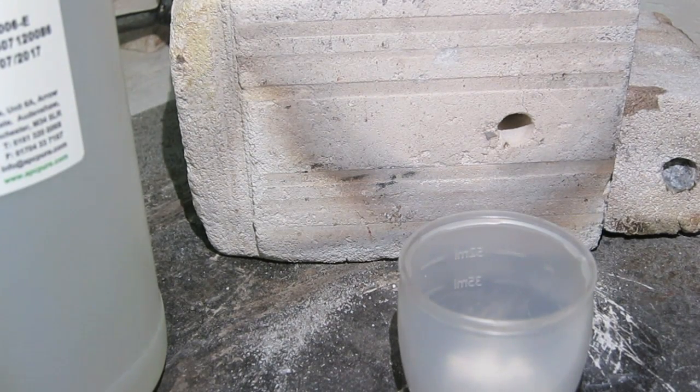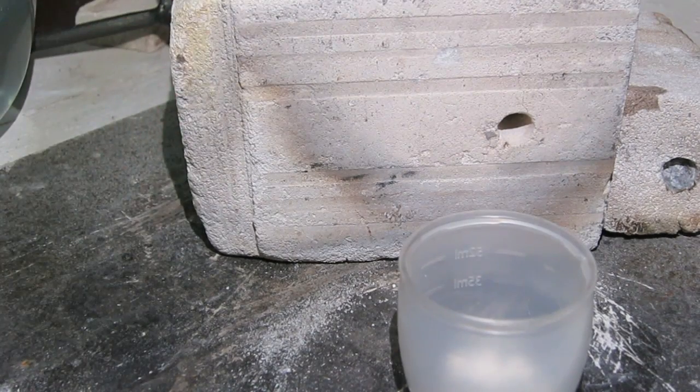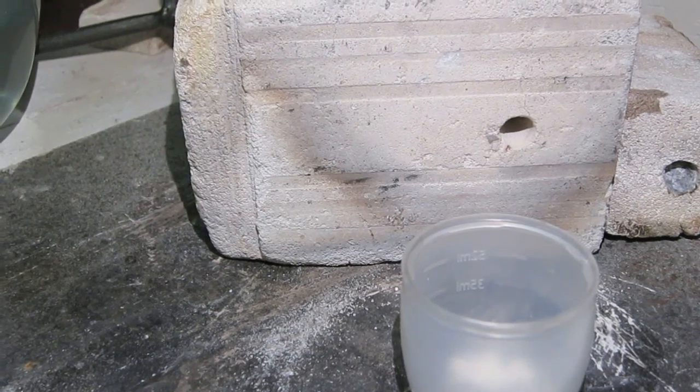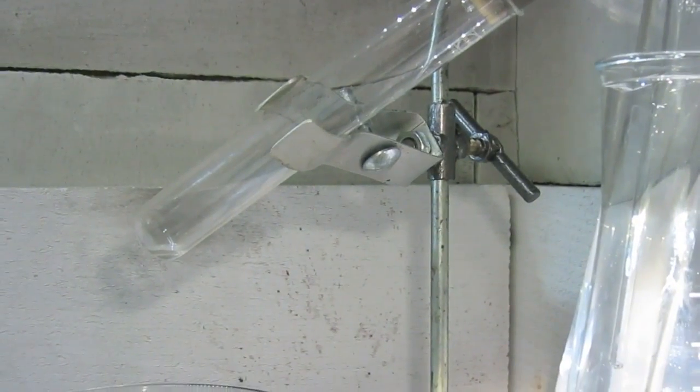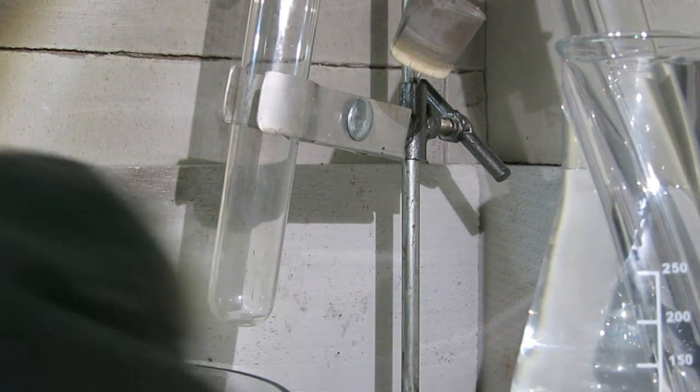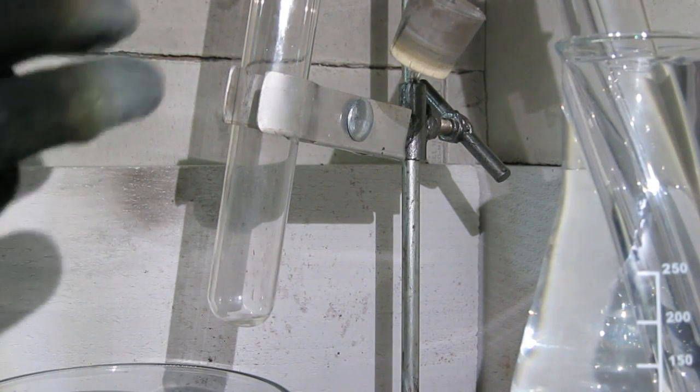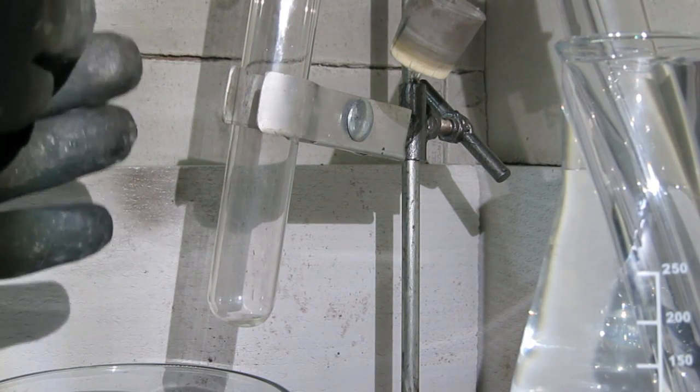What I am going to do now is putting first these two solid chemicals into the test tube. Fill in the KBr into the test tube.